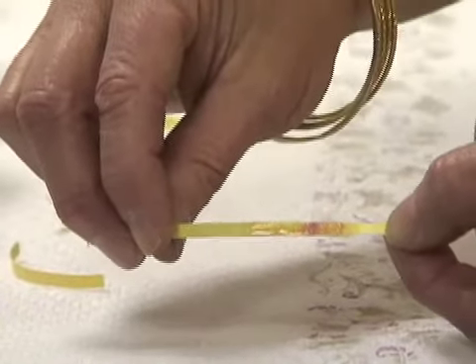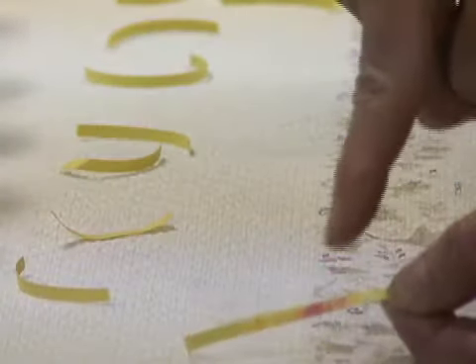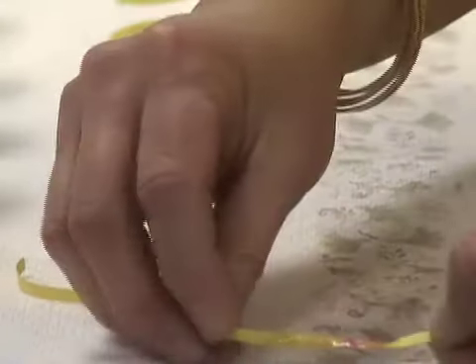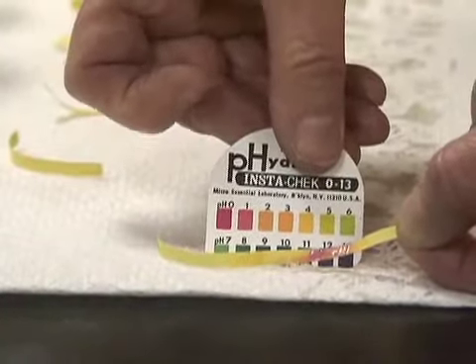Now, this is a qualitative lab where I am determining based on what I see, and I see a red, so I'm going to say that the pH is 1. The pH is 1, and my scale is here as well. That would be a 1.